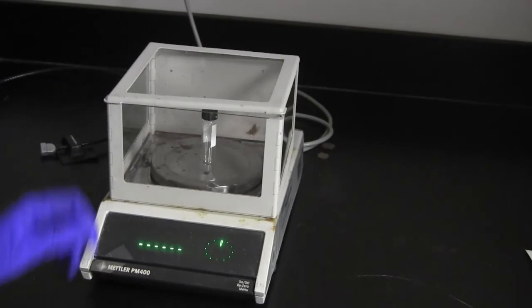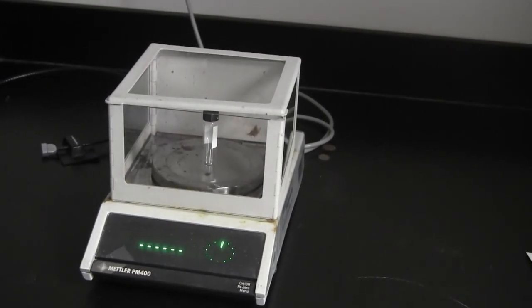Remember to weigh a vial before you put your pure product in it, and then re-weigh it to get your percent recovered.